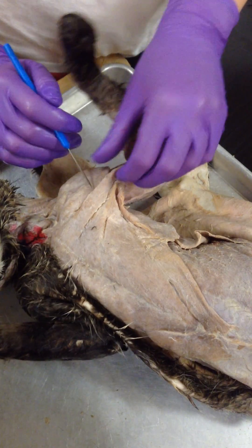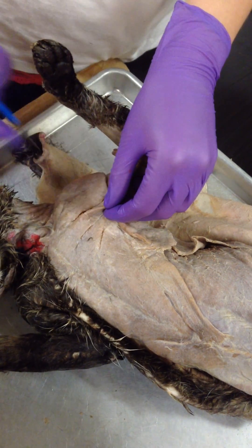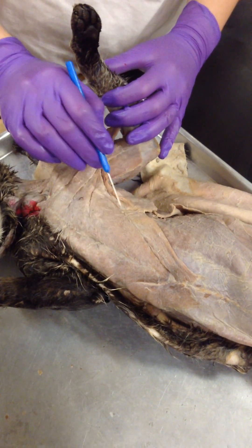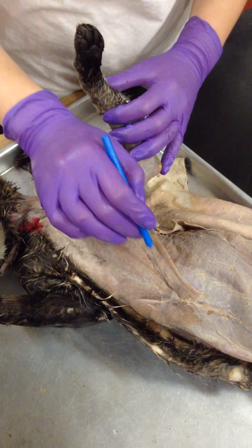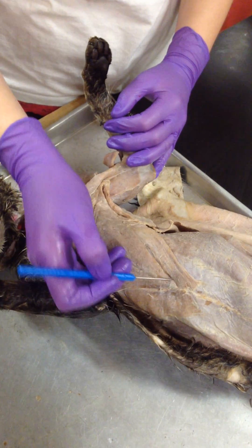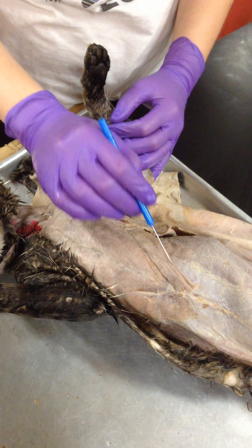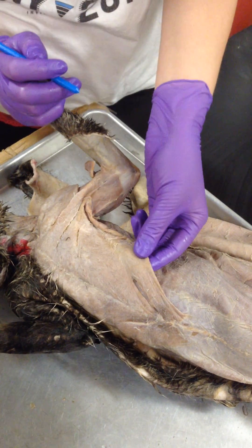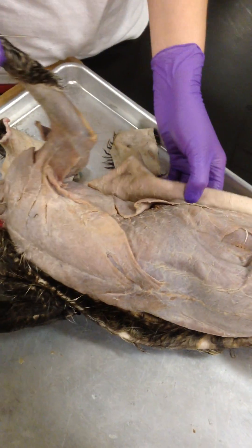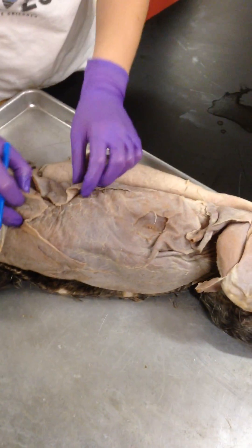See, it can kind of separate. And then beneath it, there's another line coming here. This is your pectoralis minor. This triangle. And then this other one, this tiny little guy right here underneath my hand — that's your xiphihumeralis. Off to the side, that's what covers the teres minor.